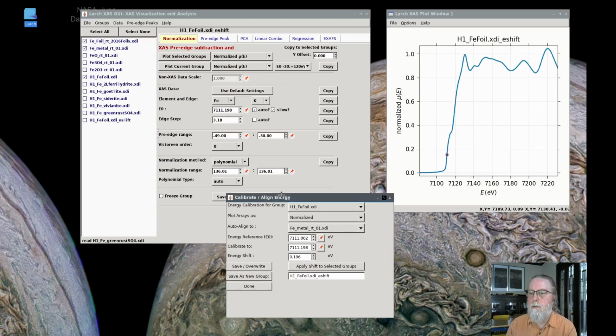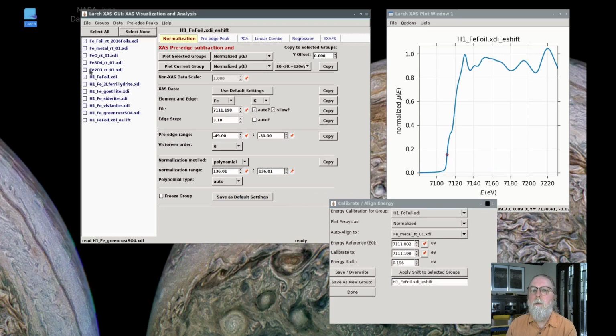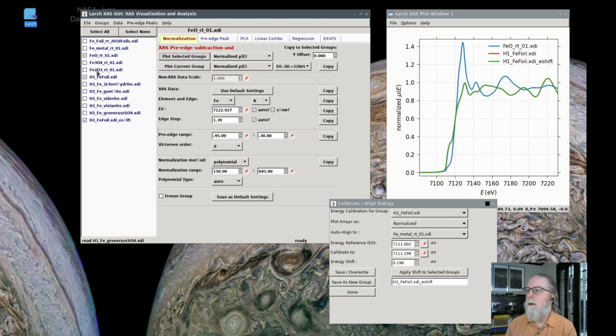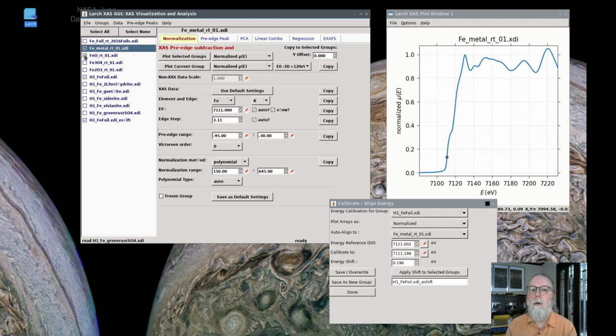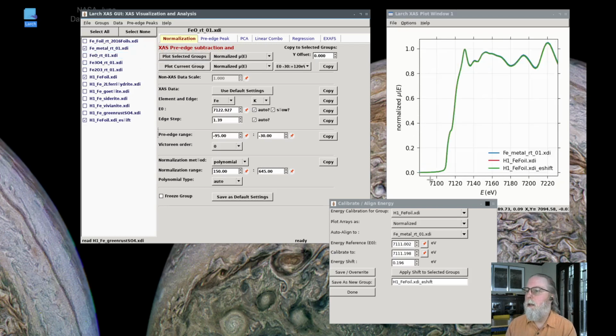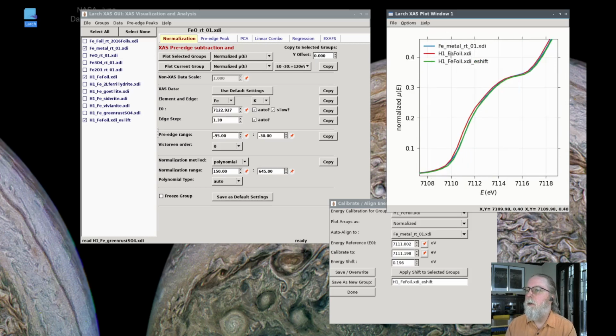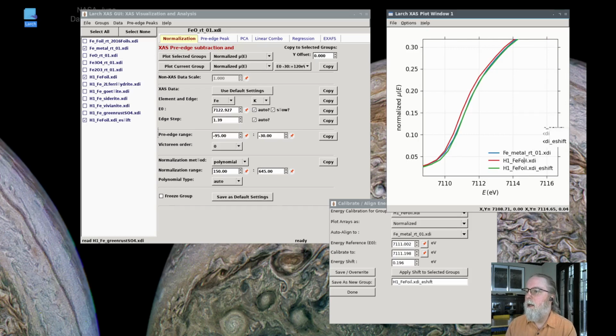I'll just save that as a group, and then I can reproduce this plot here by saying iron foil and taking those three spectra and plotting them together. Not this one, the one above it. Taking those three and plotting those together, and now the original iron foil is slightly shifted, but the other two are well within the noise of being on top of each other.